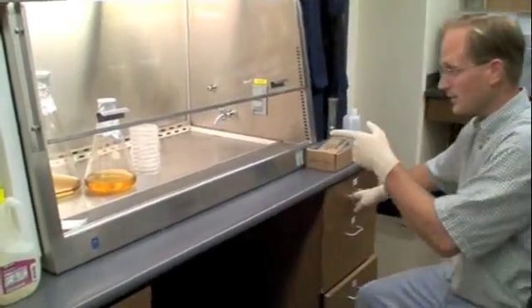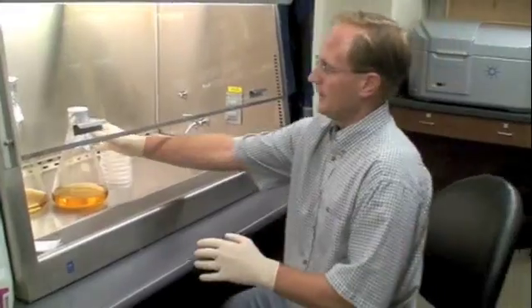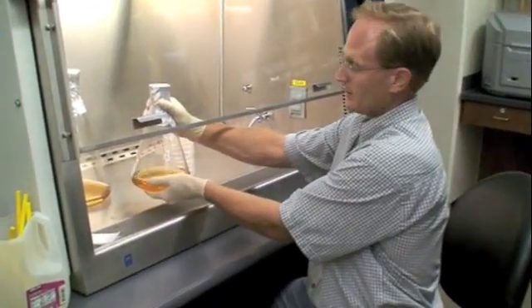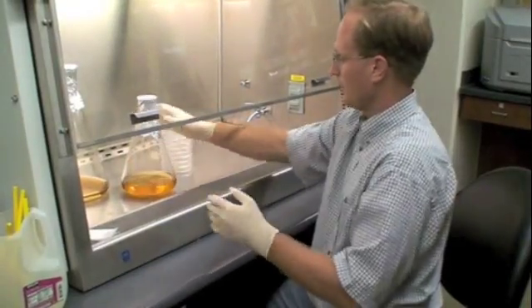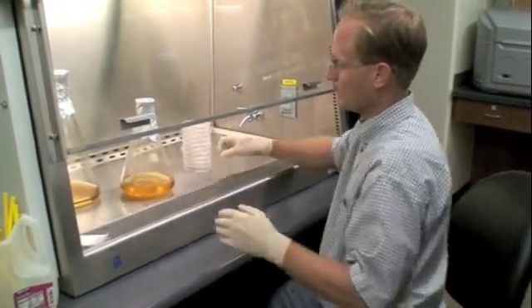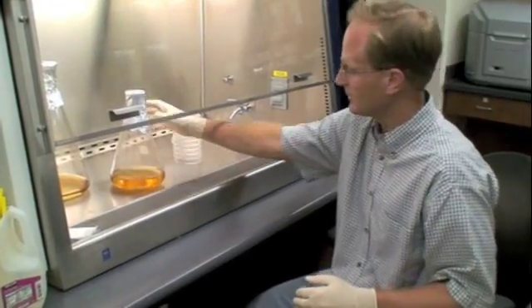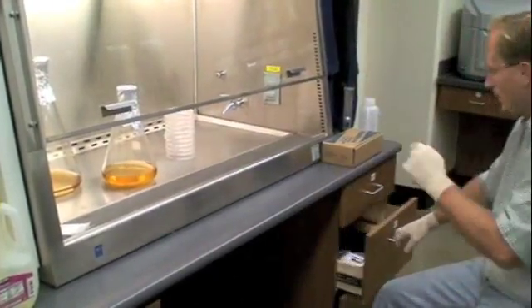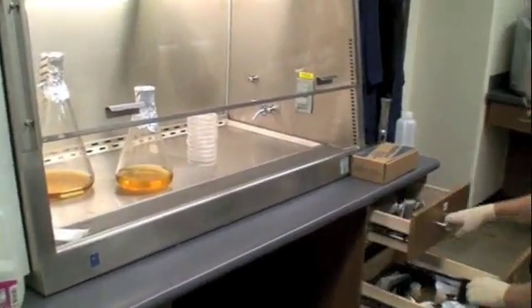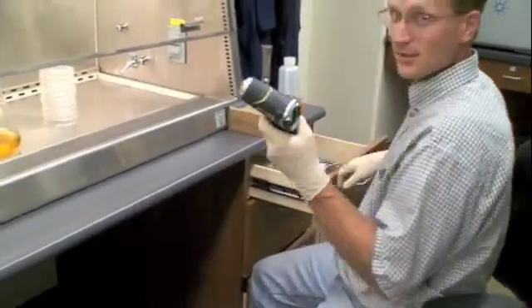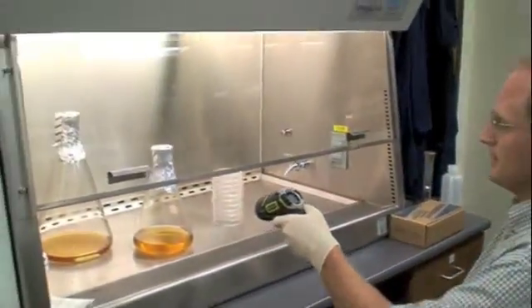So, the other thing to check is that we need to pour the media when it's not too hot or not too cold. And right now, we only have the media in here. It's starting to set. The way to check the temperature is with our little digital thermometer.